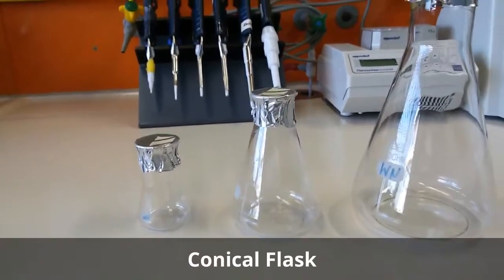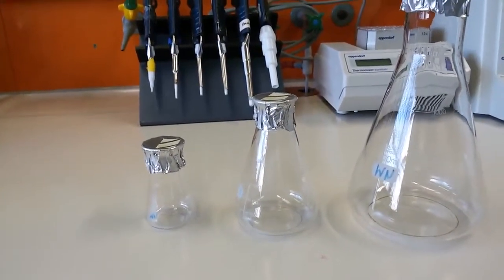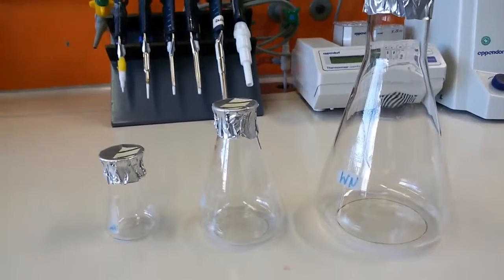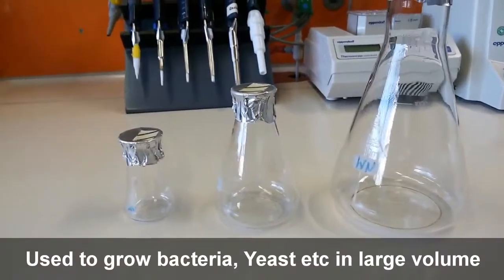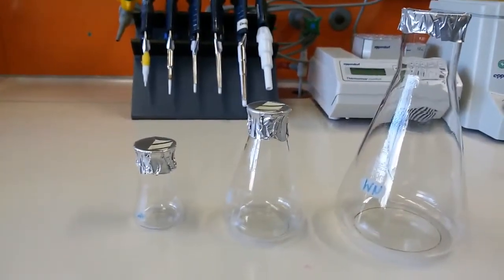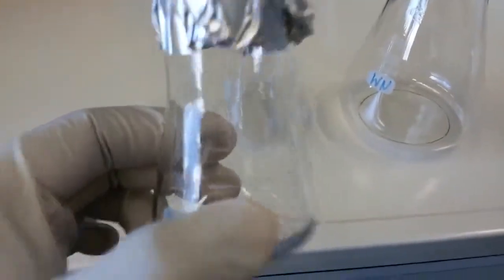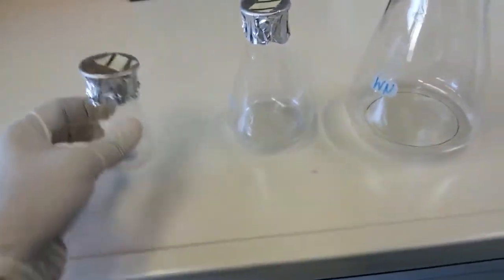Now you see in front of you conical flasks, and if you know them, that's great. If you don't know them, I will tell you. These are the conical flasks. They are a conical shape, and we use these conical flasks to grow cells, to do bacterial culture, yeast culture, sometimes animal cell culture, and sometimes tissue culture also. They are very important. They are also available in different volumes, and you can see it here. This one will show you the 50 ml, and we will only use this to grow 10 ml of culture, not more than that.